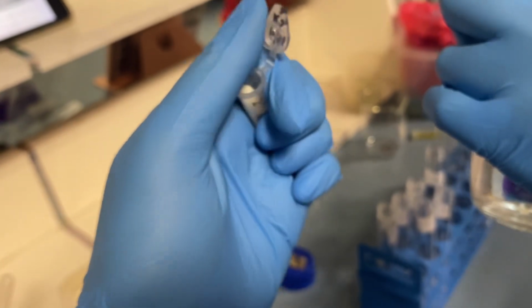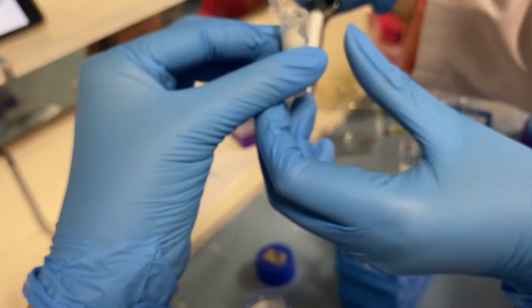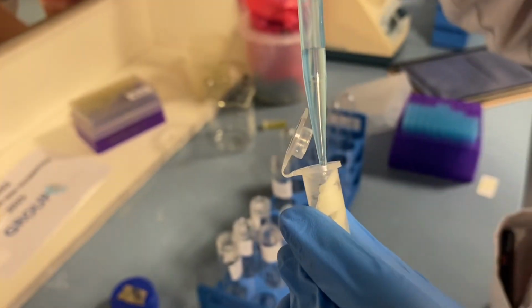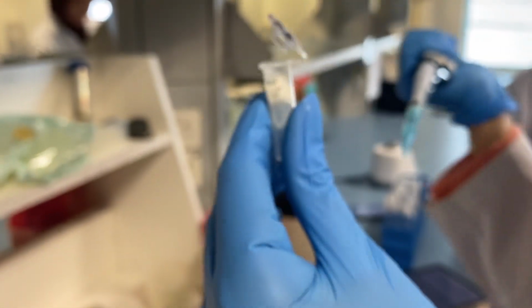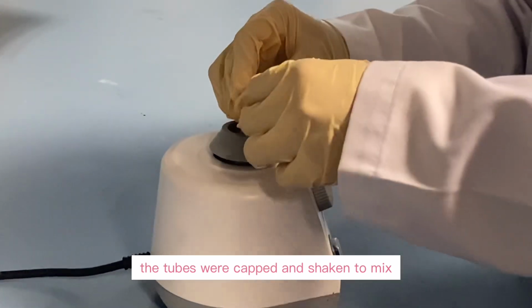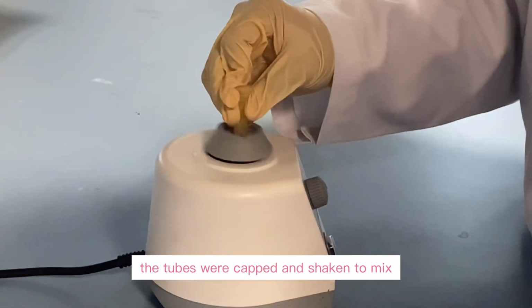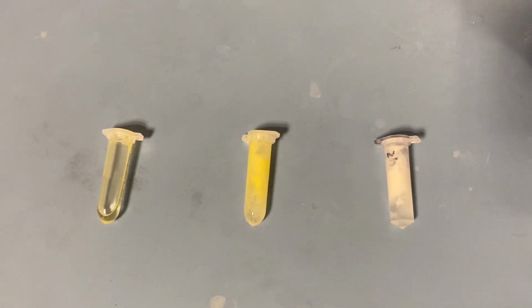Based on the manual, we also used a spatula, but it wasn't shown here because it was prepared beforehand. The function of the spatula is to transfer solid lipid samples into the microcentrifuge tubes with precision and hygiene. The tubes were capped and shaken to mix. So this is the outcome of the first set after mixing with water.